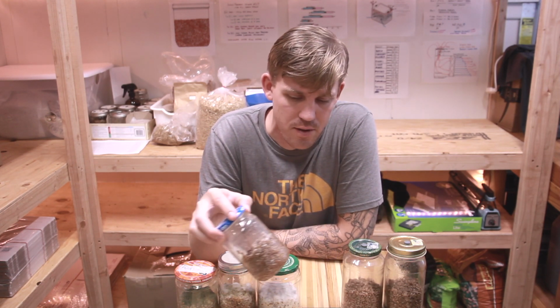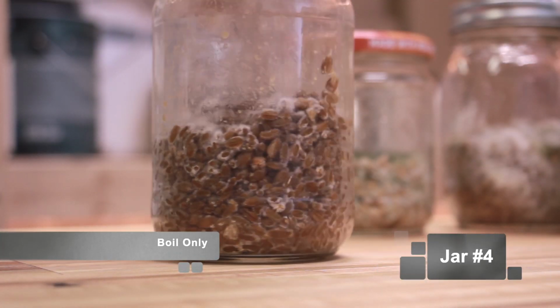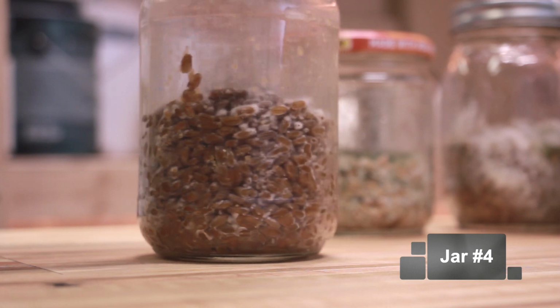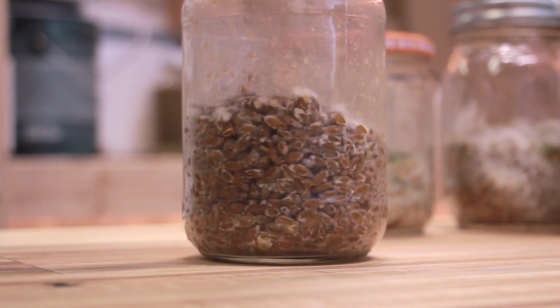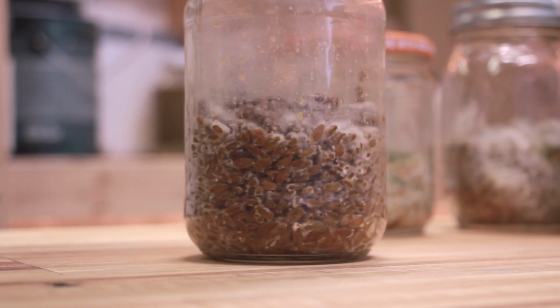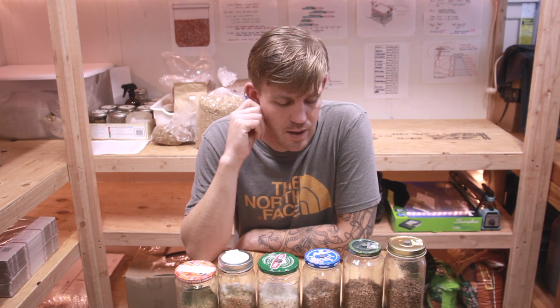So jar 4 looked the same. I shook this 3 days ago, and you can see it did not bounce back like it normally does. And the grain just looks disgusting. It got all sloppy all over the side of the jar. It's not colonizing the way that it normally does. It just looks really wet and disgusting.